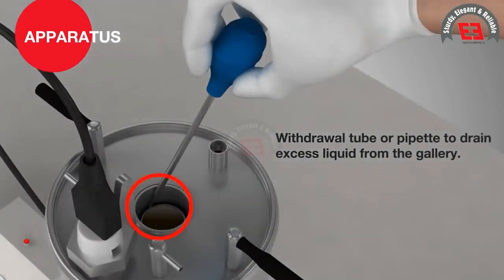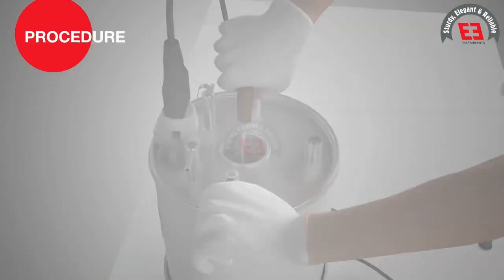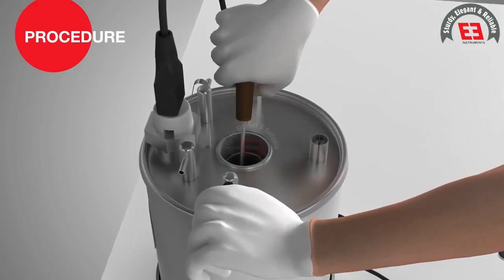Withdrawal tube or pipette to drain excess liquid from the gallery. Filter funnel to strain the sample. Procedure. The oil tube is cleaned with a suitable solvent.